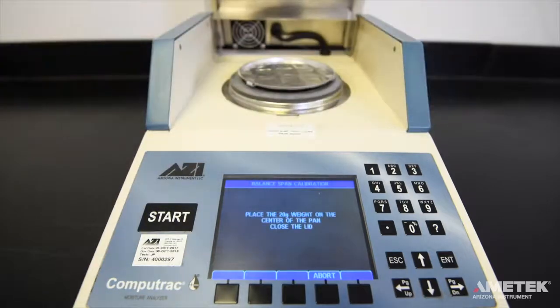When instructed, use the tweezers to place the 20 gram weight in the center of the pan.